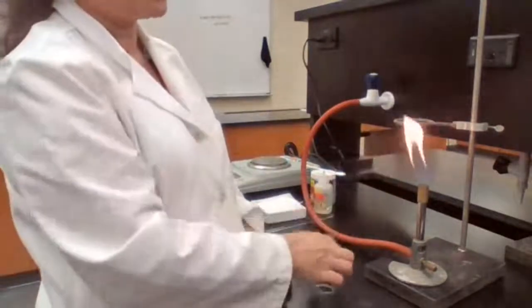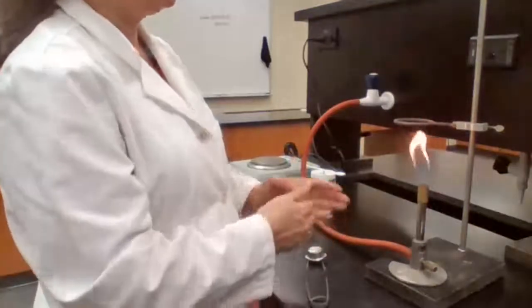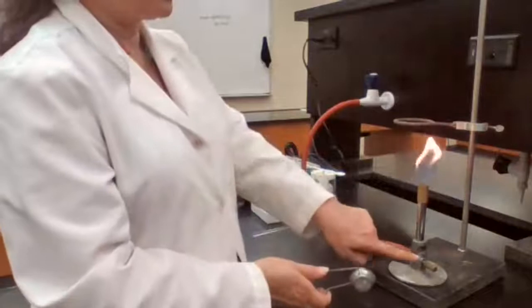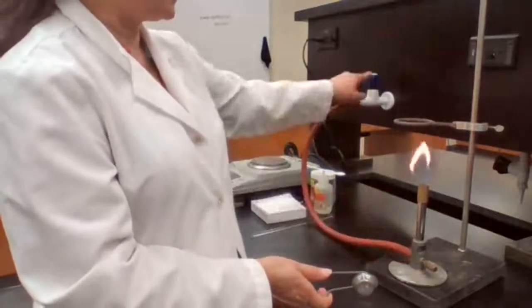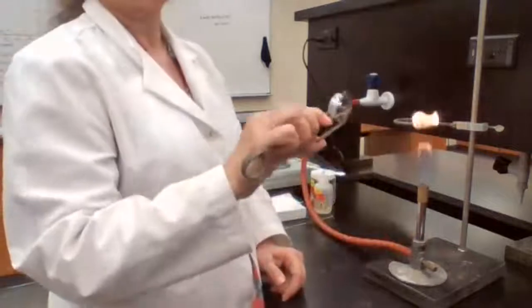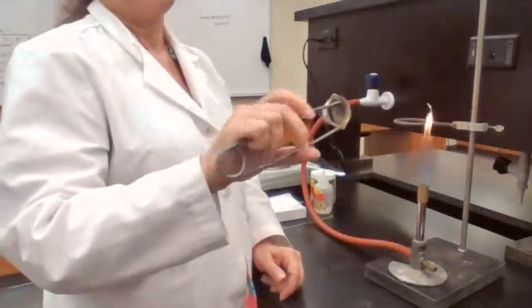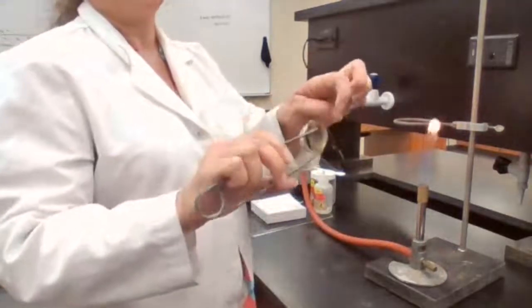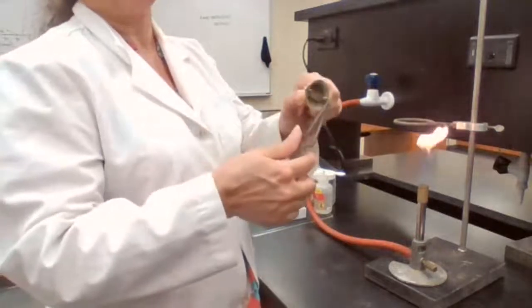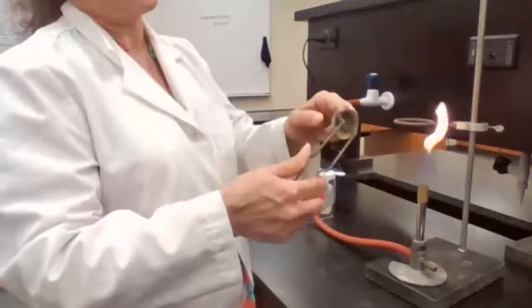It's like 2 times, 3 times strike, it doesn't turn on. You have to make sure your adjustment, make sure the gas is open, some air is allowed. The striker is working. When you try the striker, you should see a spark here. Sometimes by moving it up and sliding, you don't create any spark, so it's not working.